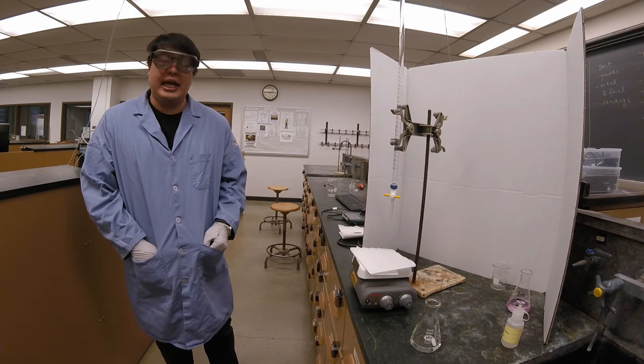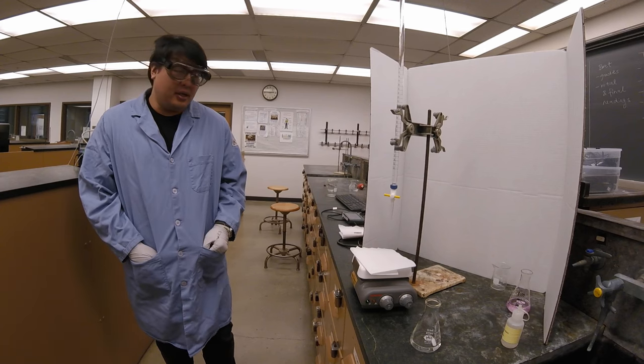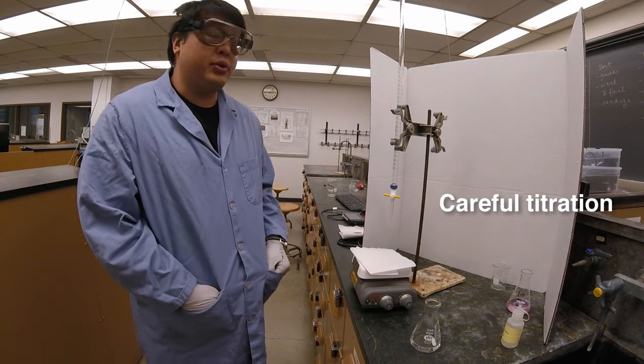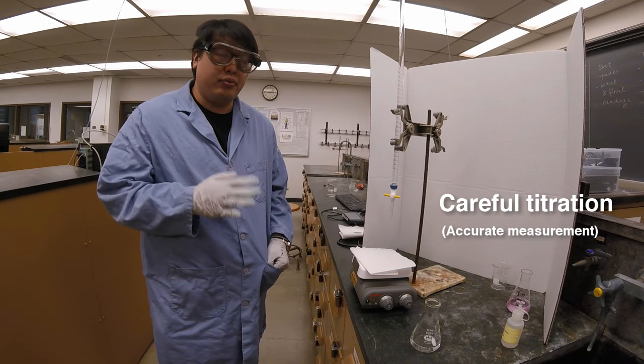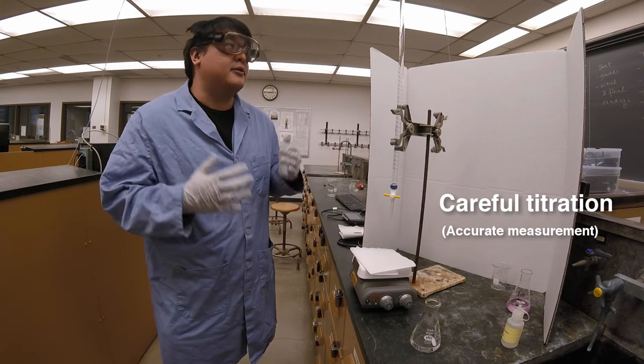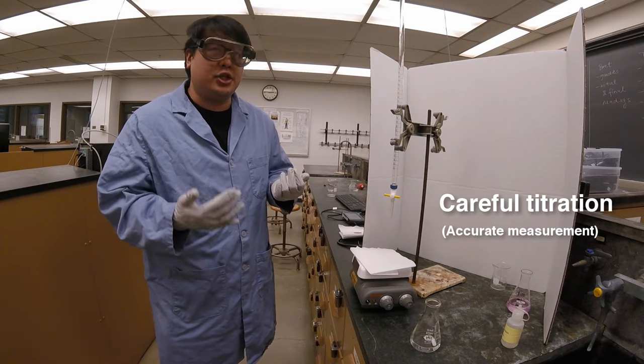This is a video about doing a careful titration. It's really important that when you do a careful titration, you get accurate volume readings, both initial and final. Right now, I'm going to take the initial volume reading.